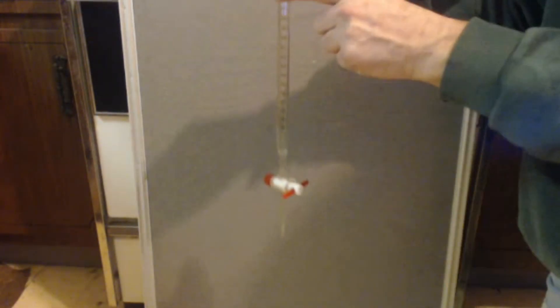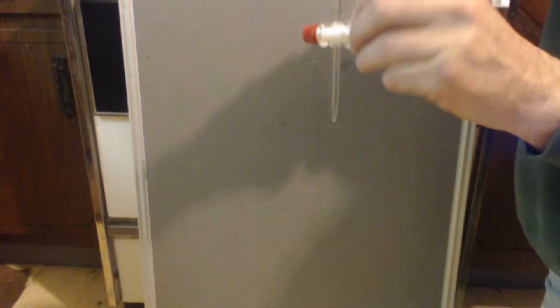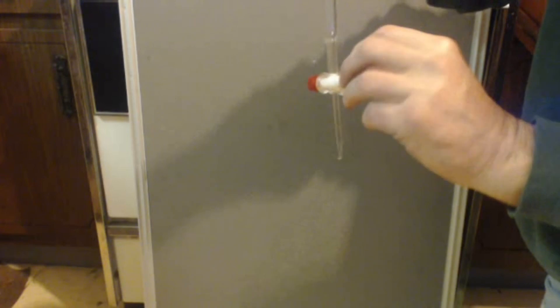You want it to be precise. It's not like you're using a liter. Here I got a 50 milliliter one — it's got the clamp, see. Put that on there and just hang it up like that. That way when you put your stuff in, you know exactly what's there. You open this up, titrate, titrate, titrate. When you're done, you get an exact reading again, and then you can take the difference to know how much you used.